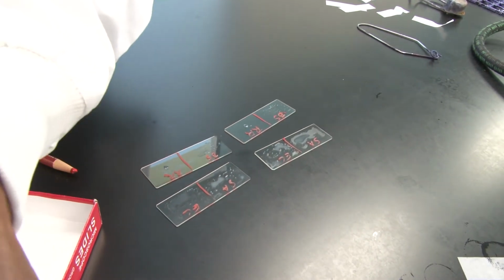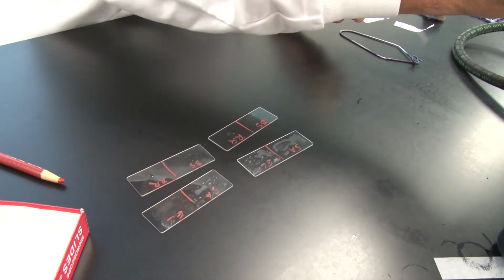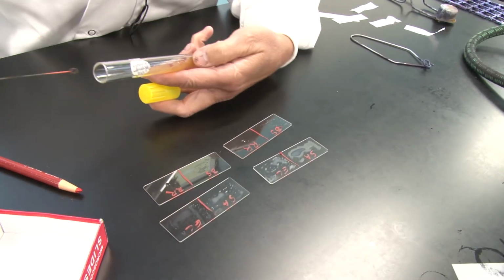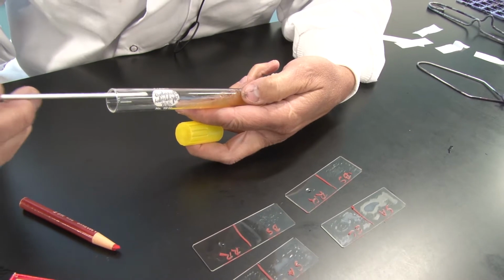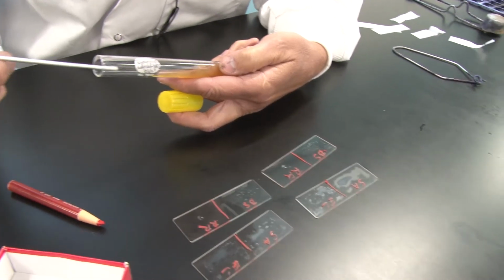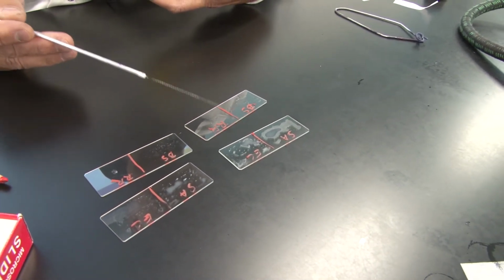Take my last stock culture and I'm going to go down into the agar, cool it down. You may be able to hear that sizzle. On this, I'm going to grab some of this red material here, bring it up, and I do have quite a bit of Rhodospirillum on here.